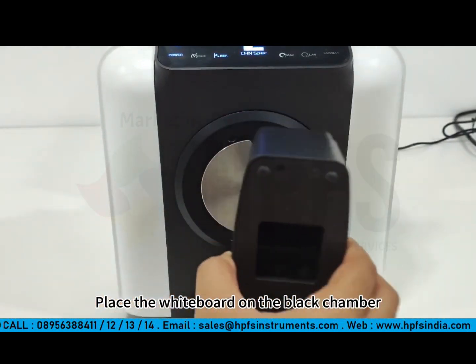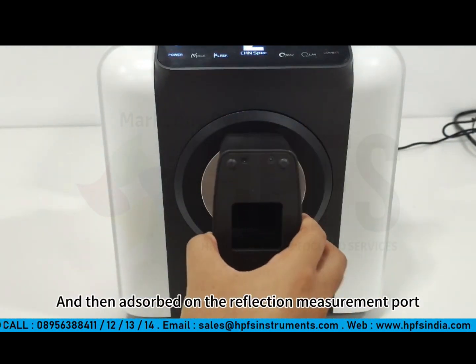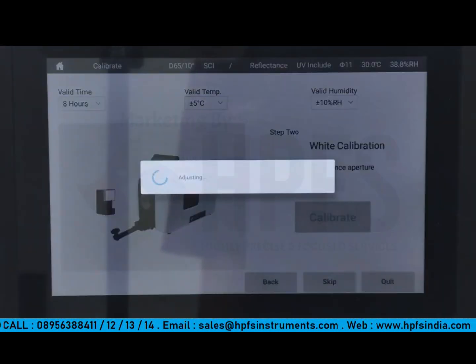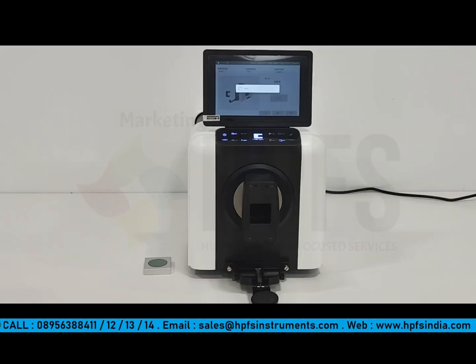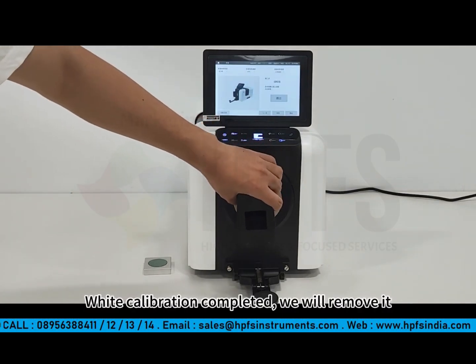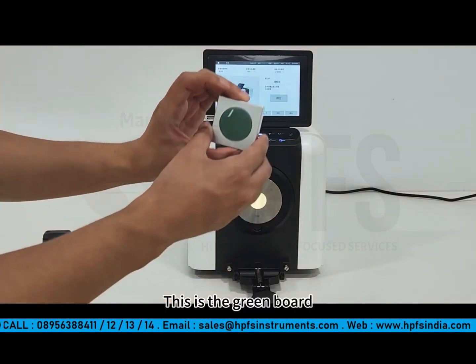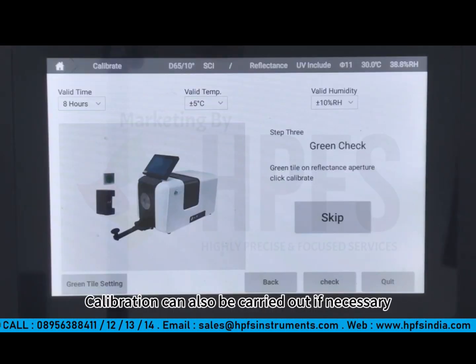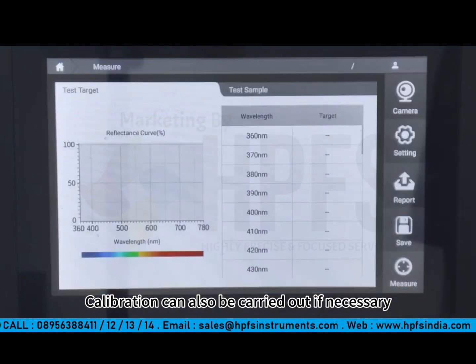Place the whiteboard on the black chamber, and then adsorb it to the reflection measurement port. Click on Calibrate. White calibration completed. We will remove it. This is the green board. Generally, skip the green check option. Calibration can also be carried out if necessary.